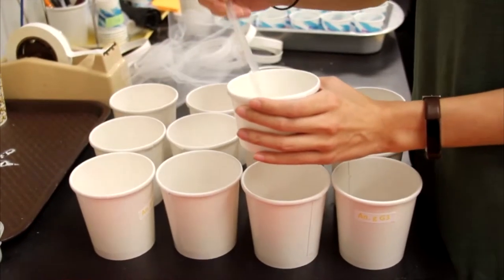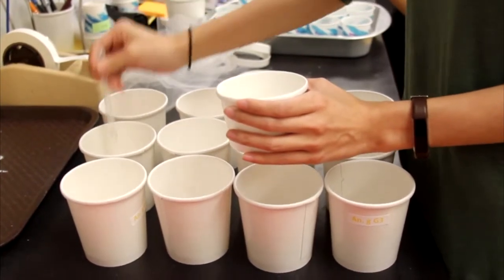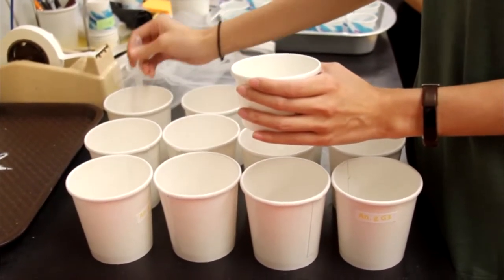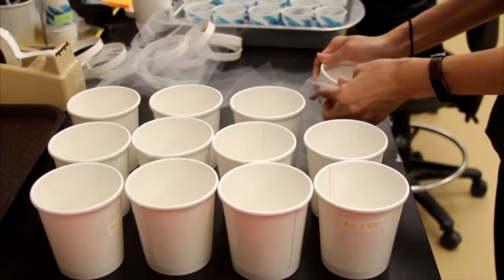Pipette the pupa into male and female cups. For females, pipette around 10 pupa into each cup, and for males, pipette 20 to 30 pupa. Cover each cup with a lid and netting.